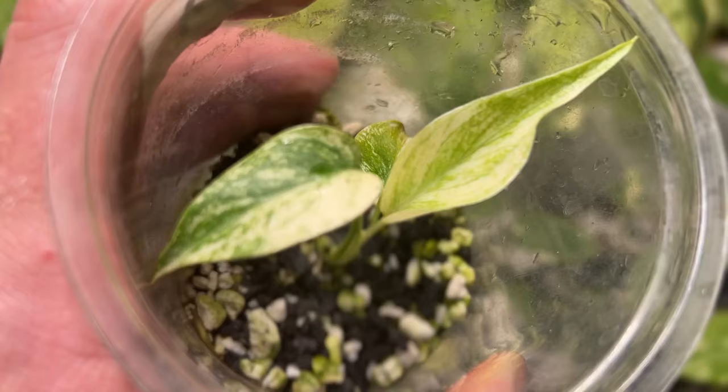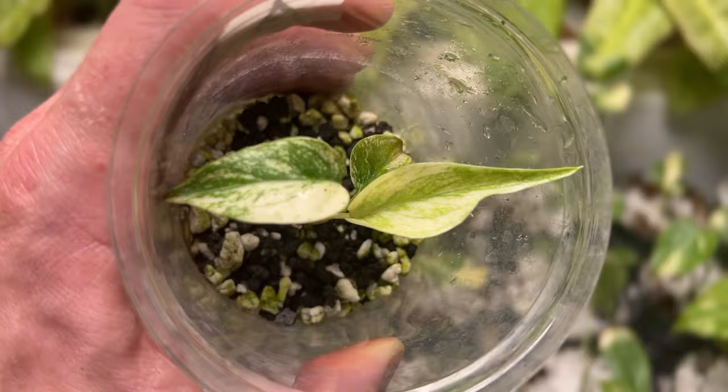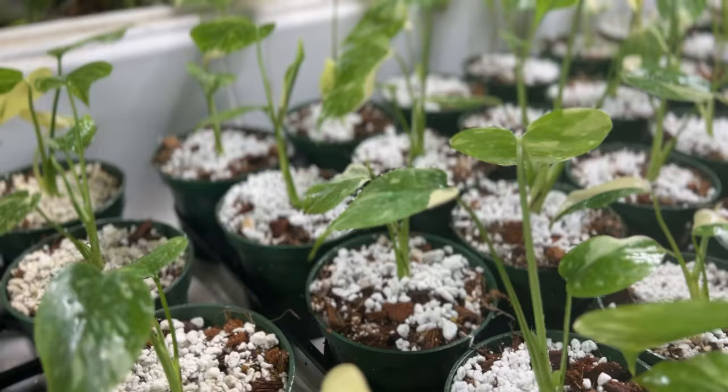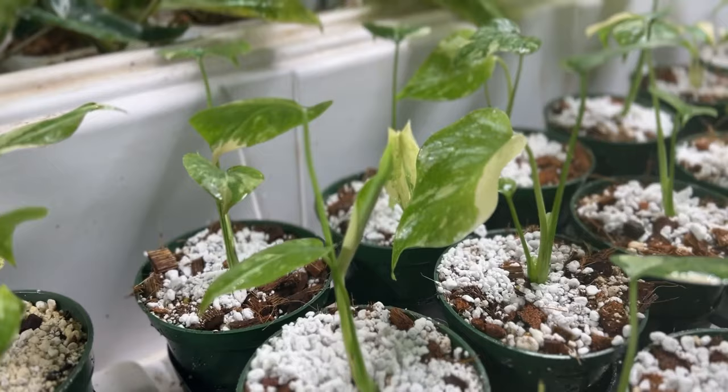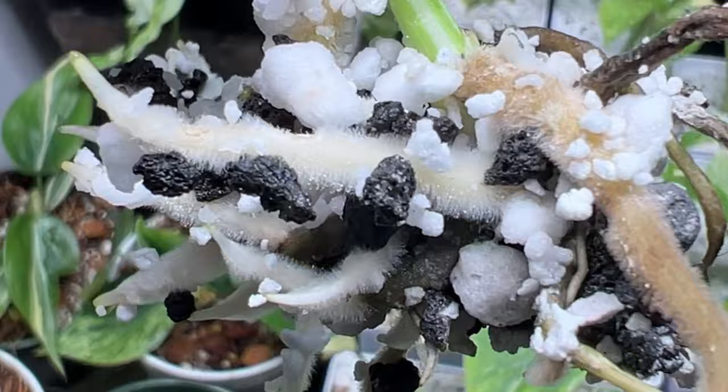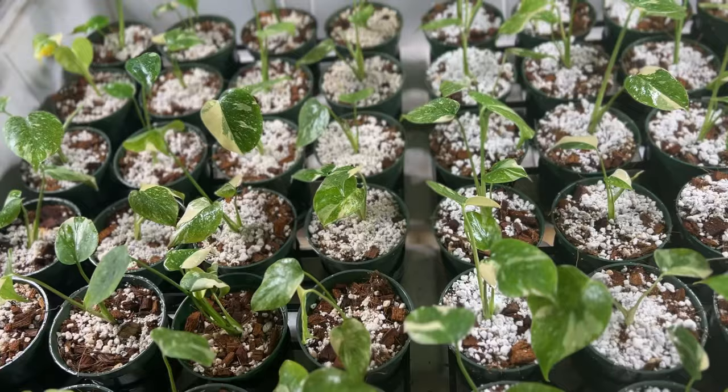These rooted plants will then be transferred into the acclimation process. This consists of maintaining high humidity levels, warm temperatures, and limiting biological exposure, similar to an incubator. This is a challenging process for many plants such as Monstera Thai constellation. Fungicides as well as beneficial microbes can be implemented to improve success rates. Once plants have acclimated, they will enter the greenhouse for further growth.